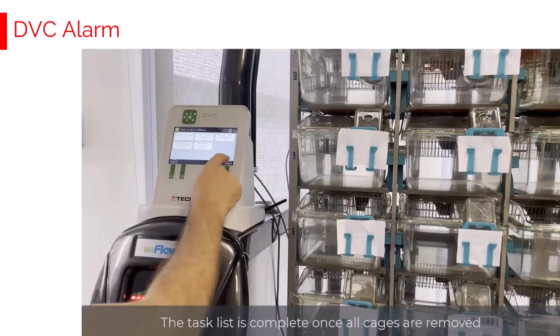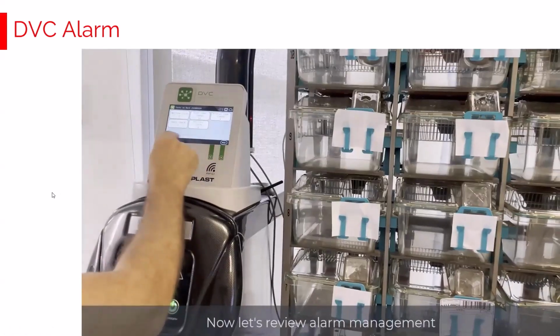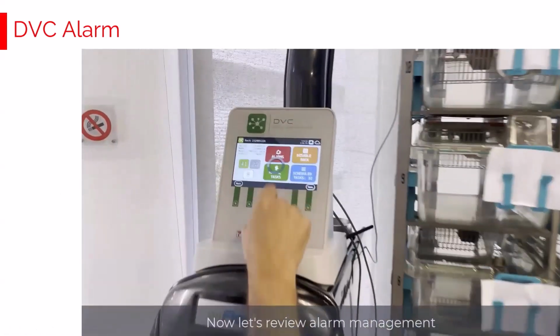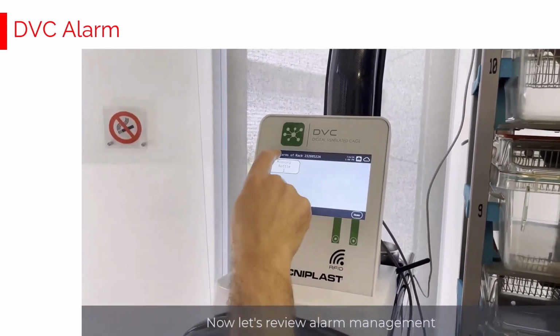As promised, let's have a look now at how to handle alarms in our preferred workflow. That is not considering anymore the DVC operator interface, but directly interacting with the DVC master interface. Now, let's have a look at the open alarms in the system. Again, through the DVC master interface, there is the possibility to click alarms. There is one active alarm.